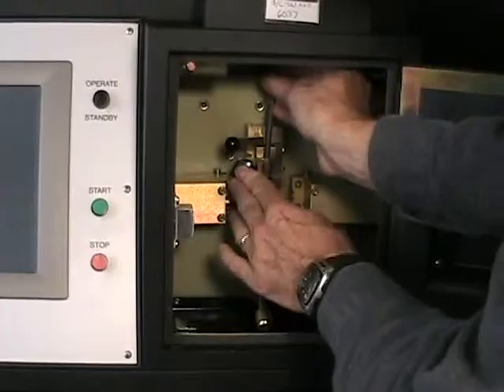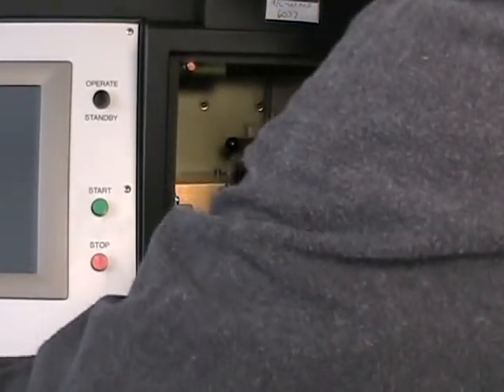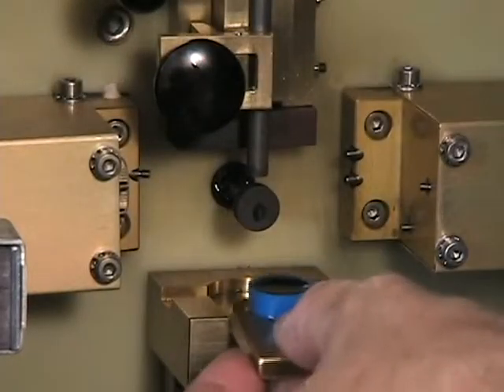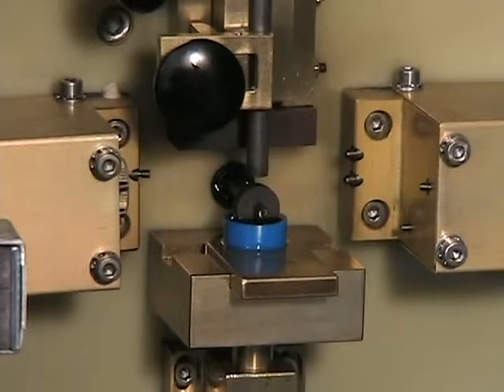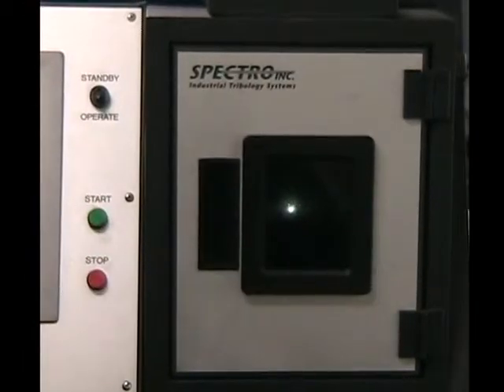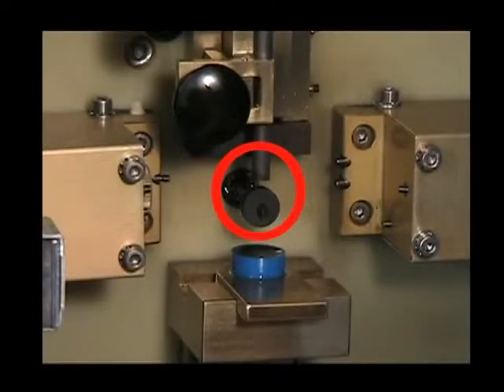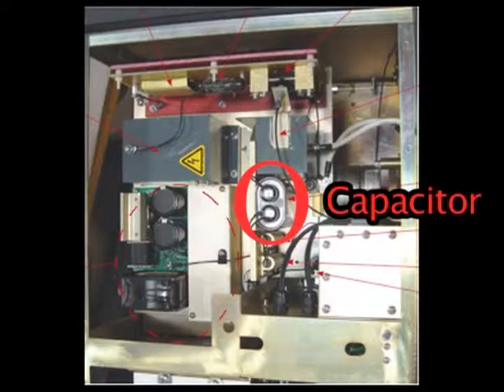To run a test, the rod and disc are placed in the sample stand and the gap is set. A sample of 2 milliliters that requires no preparation is placed on the sample table, which is then raised so the disc electrode located on a shaft is partially immersed in the sample. Once the start button is pressed, the disc electrode rotates on the shaft and carries the sample into a gap formed by the two electrodes. An electric charge stored on a capacitor is discharged across this gap, creating a high-temperature electric arc that vaporizes a portion of the sample, forming a plasma.